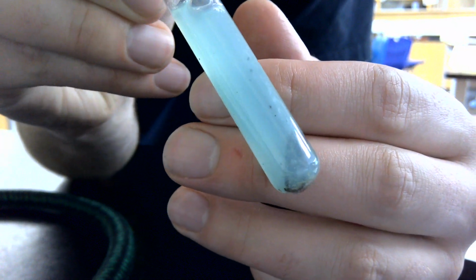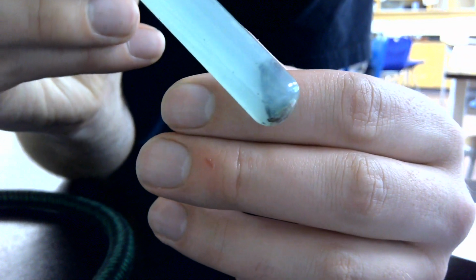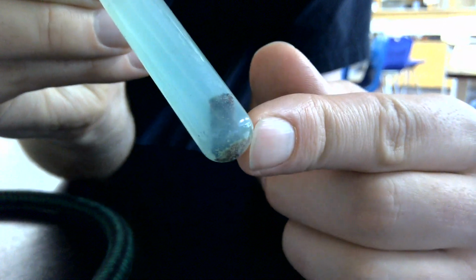But the magnesium has a bunch of these little dark bits on it. You can see it's turned darker. There's a bit of sediment forming in here. There we go. You can see there's some sediment bubbling. There's the magnesium. So take your observations on this, and then I am actually going to dump out the liquid, and we can check out what that magnesium looks like inside.